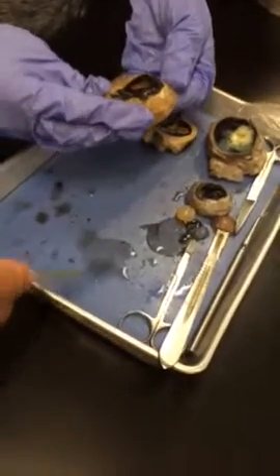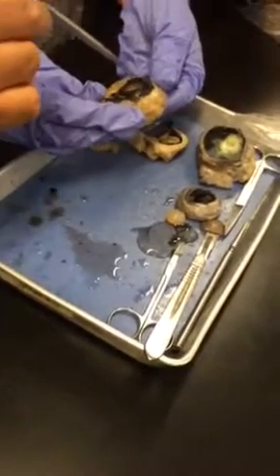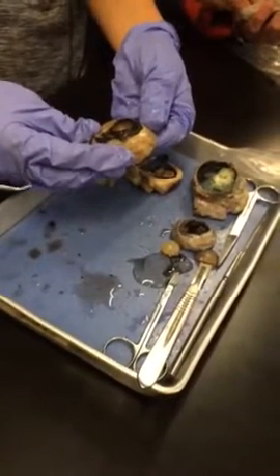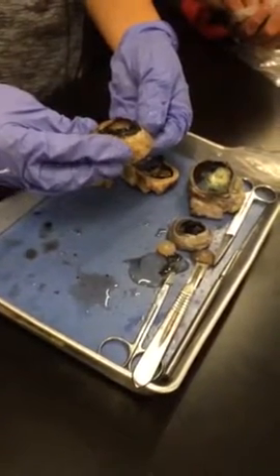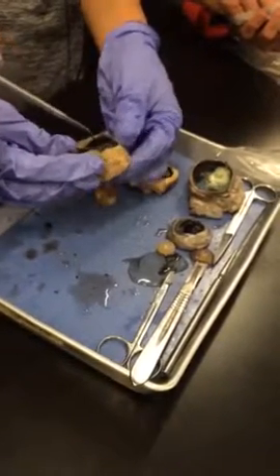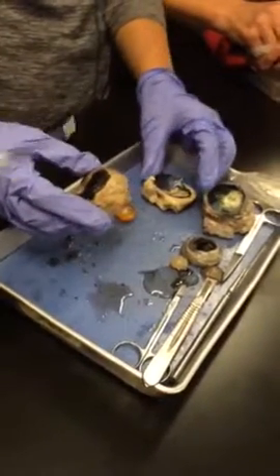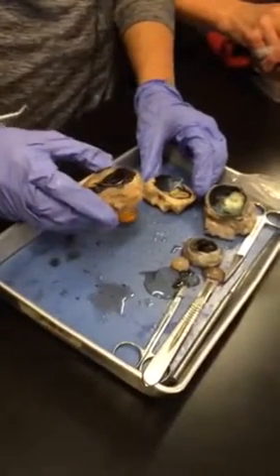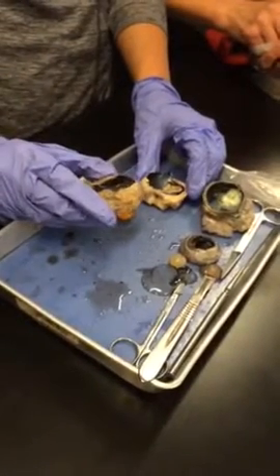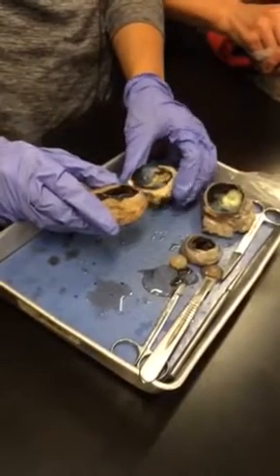What kind of fluid would you find there? Aqueous humor. Right? What is that structure? The lens function? Focuses the light. And if we go ahead and drop the lens, the opening, pupil. Now the iris will constrict or dilate that pupil to do what? To filter how much light goes in. To regulate the amount of light, right, that comes in.